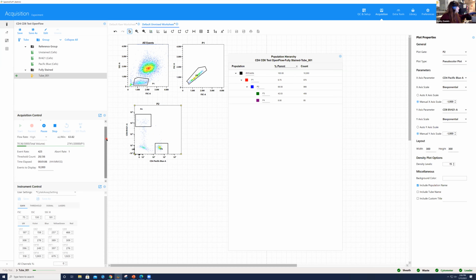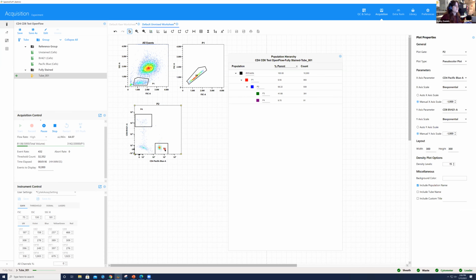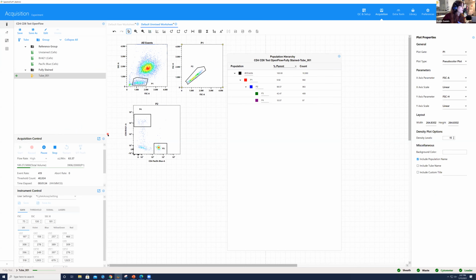It looks like we don't have as many CD8s as we have CD4s in these lyophilized cells, but what we do see is we see the nice resolution of the populations, even though these two fluorochromes are traditionally something that you would not be able to look at on a conventional cytometer, okay? So we're able to see them. I'm going to go ahead and continue on recording and see if anyone has any questions on this specific data set as we're going along.